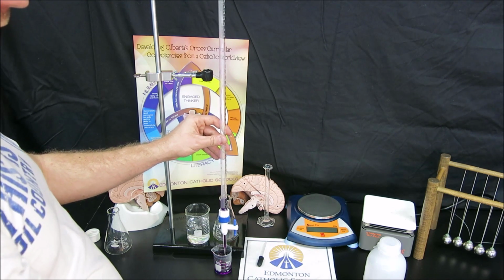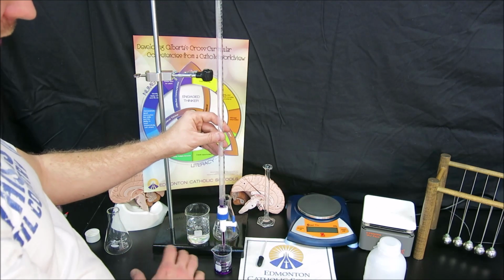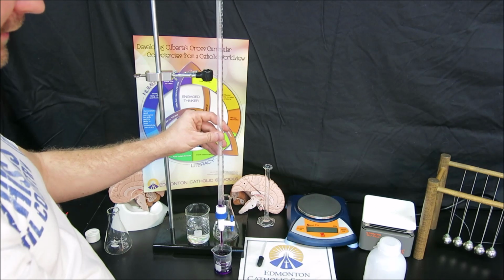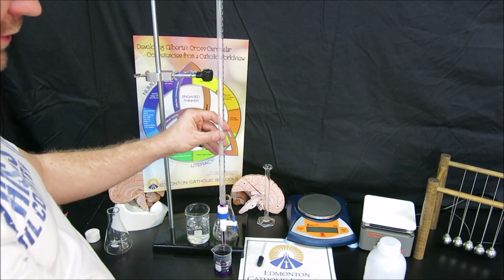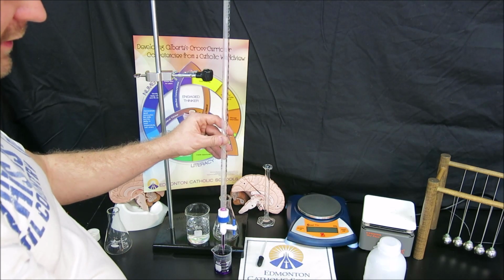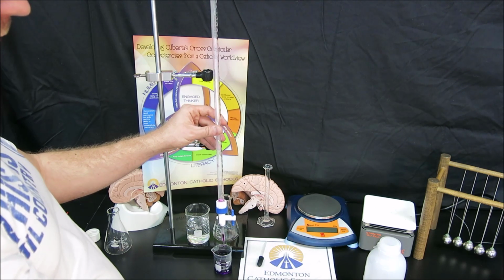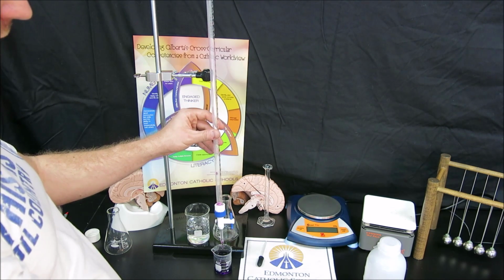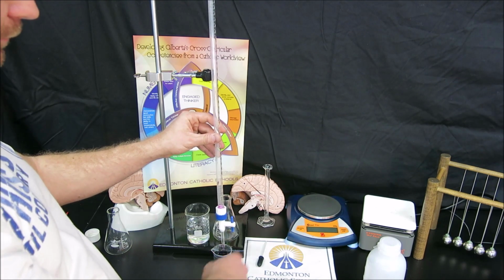You can see that titration is a slower process, as this is fully open and this drains at a very set rate. You can't make it drain any faster. So you need to make sure not to rinse with too much, otherwise you'll be draining for quite a long time. Now, when the drain is complete, you will see there is a little bit of titrant left in the tip. This is a good thing because the volume of the burette is actually calibrated to include that little bit of titrant in the tip.